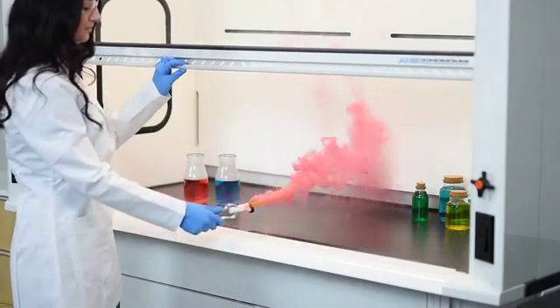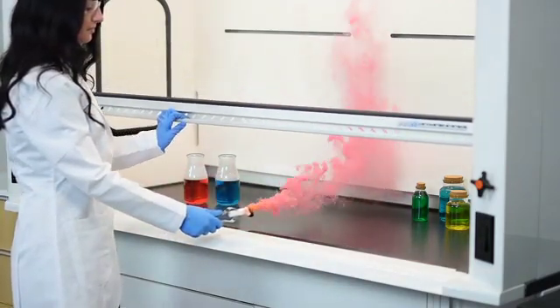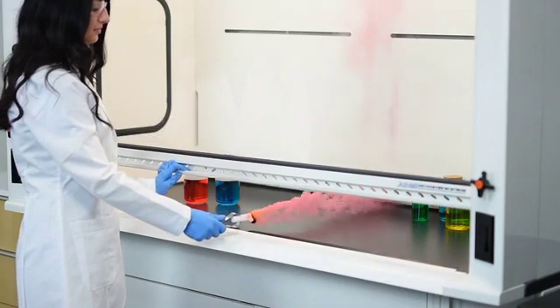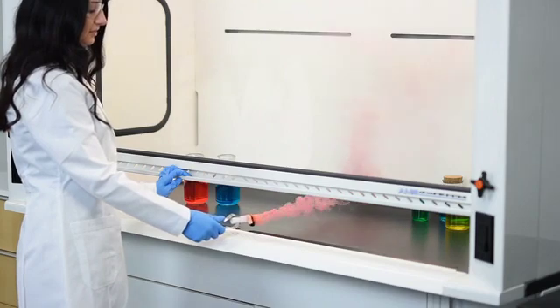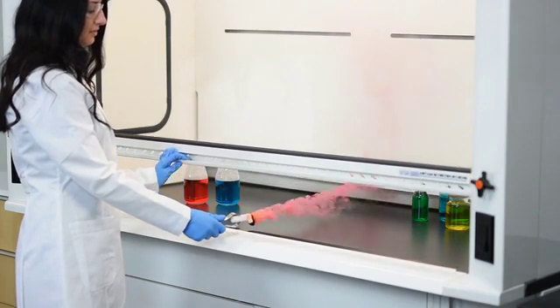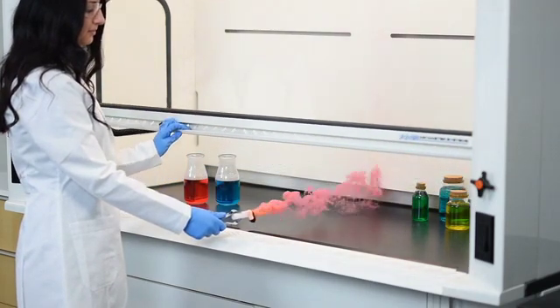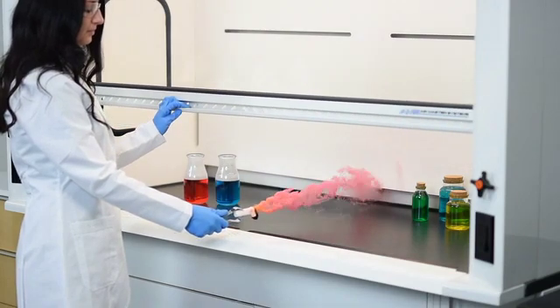Alright, let's bring that sash down a little lower now. As you can see immediately, the velocity increases. This is the reason why you want to always operate with your sash at the lowest height possible that is comfortable to work with your arms underneath the sash. This should always be below your face, no matter what.